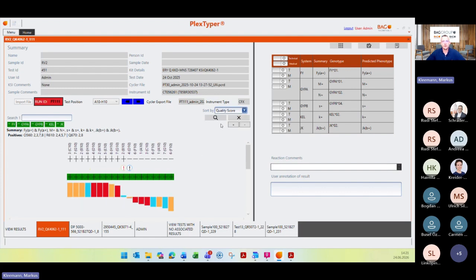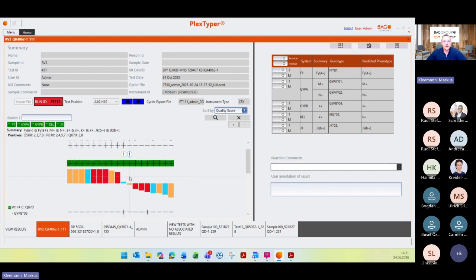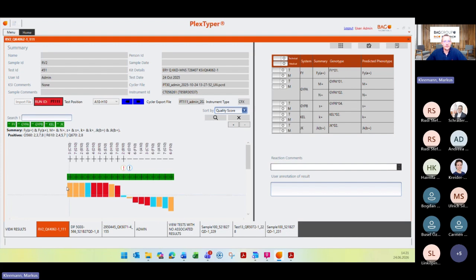But today I want to talk about this quality score. So you can see here on the left side in yellow, for example, this bar, which has the highest score for the positive reactions, which is 10, and goes down to 0. And for the negative reactions, from 0 to -10. And that means that you have the reaction quality, which is based on different parameters I will show you now.